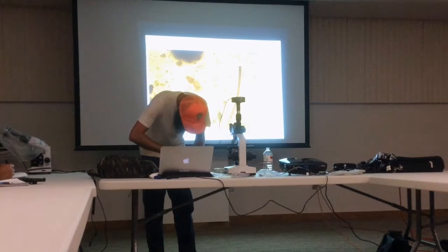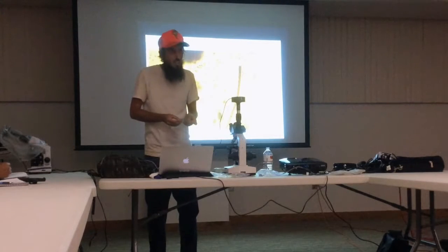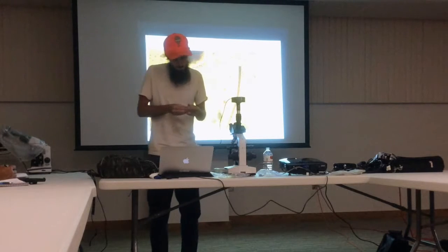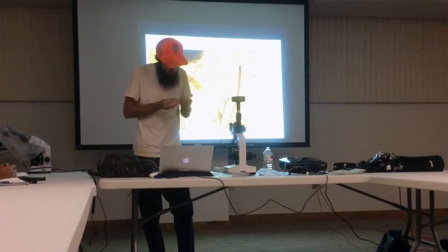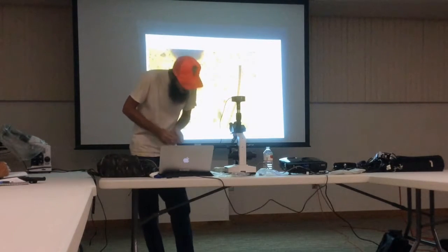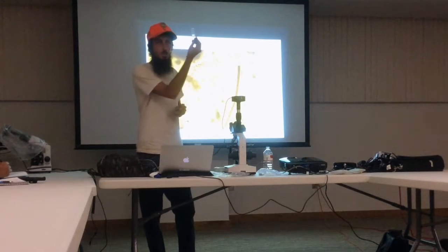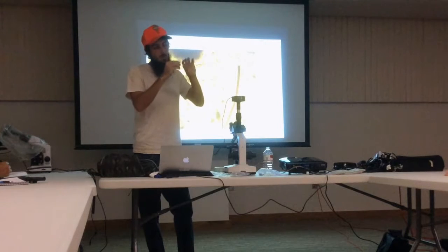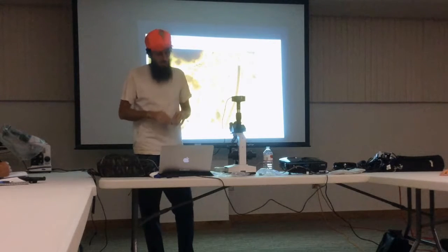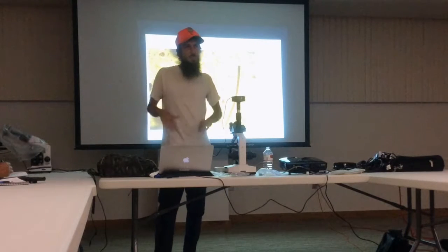I recommend you try to get glass slides too, if you can, even though they're fragile and sometimes they get stuck in your fingers. Plastic is not as easy to work with. Do you use slides that have a little depression in them? No, I don't. I do have one, like this one right here has the dimple in it. But I'm trying to get it flat and not have too much depth, because the organisms are kind of going to die. I'm going to smush them.